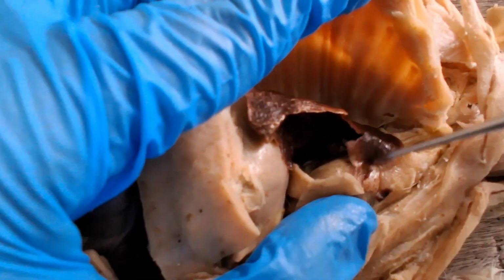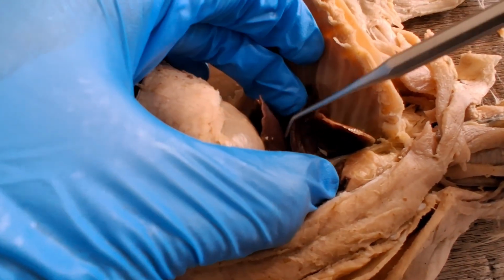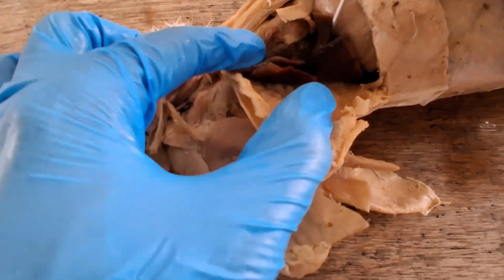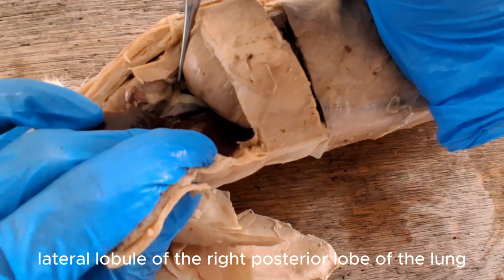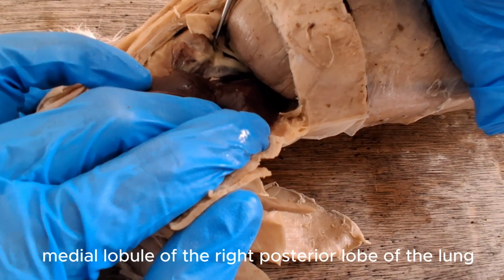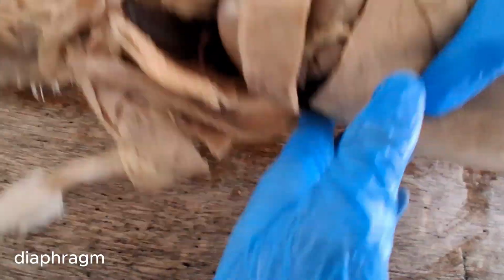In the right lobe there's an anterior, middle, and there's a posterior lobe of the right lung. So the posterior lobe of the right lung is further subdivided into a lateral lobule, the one you're seeing immediately, and a medial lobule there tucked inside the caval fold. So it's inside there, the medial lobule of the right posterior lobe of the lung. And this dome-shaped muscle is the diaphragm, the primary or the main breathing muscle that you use.